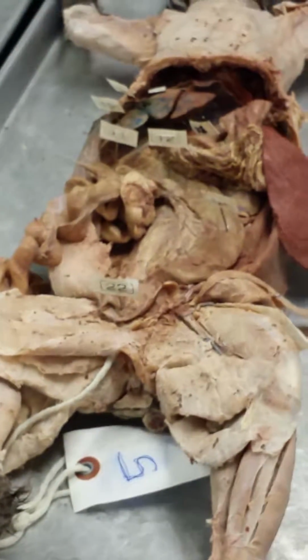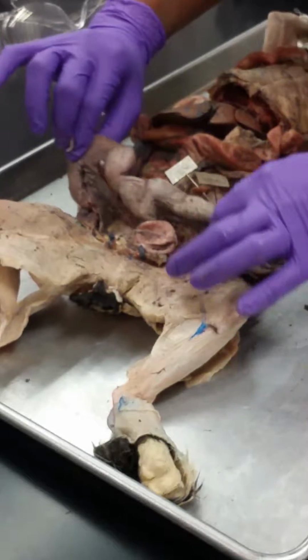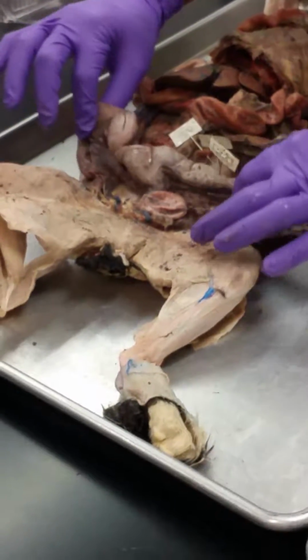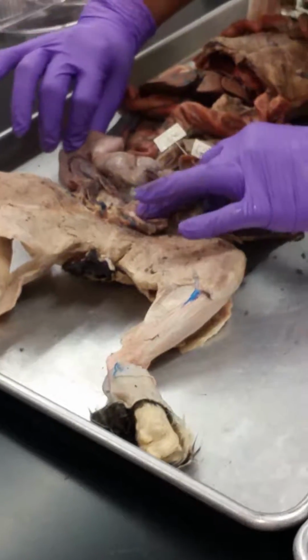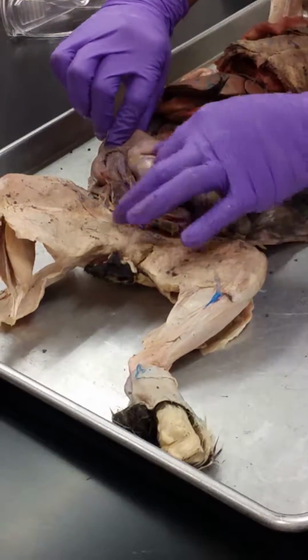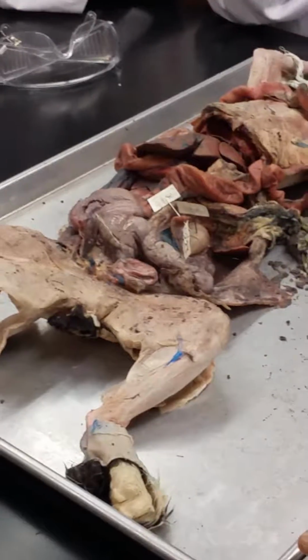Keep it in place. And then for the female, uterine horns. Alright, so this is a female cat here. And you see these two sides that I'm holding on to? These are uterine horns. It's like a huge fallopian tube, really, for the cat. Just a huge fallopian tube kind of structure. So the 2 uterine horns. And then a uterus. And where the 2 horns meet in the middle, where they meet in the center, this is the cat's uterus. That's it. All right, so we can leave this out, and these are our exam cats.